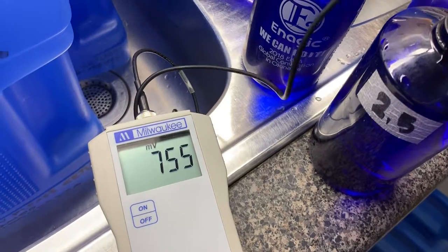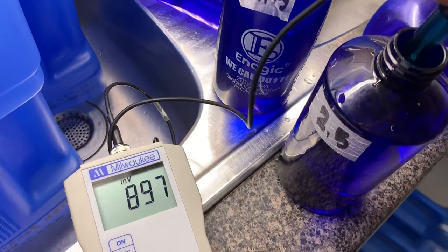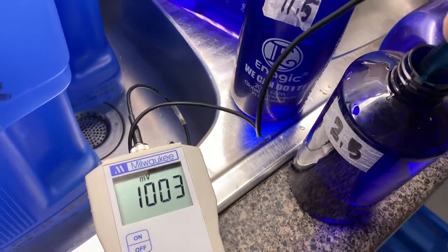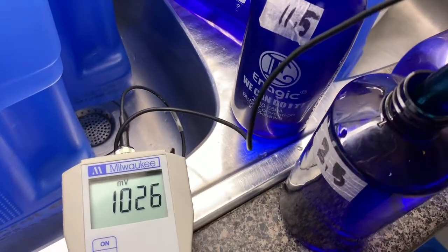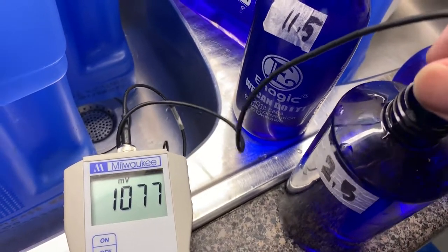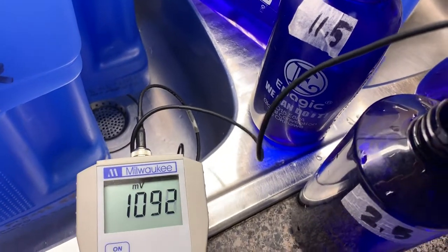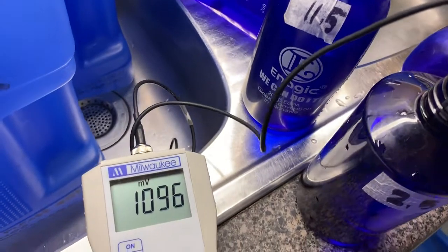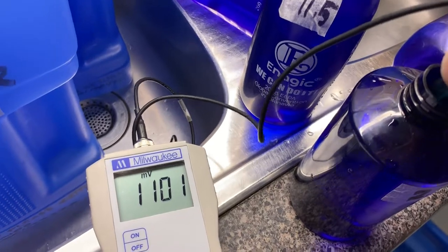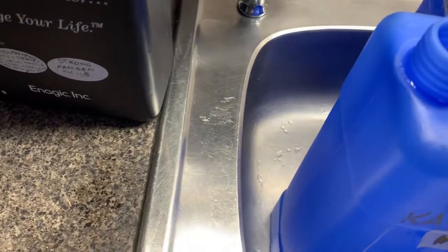See it jump to 700 now on the 2.5. Wait till it reaches 1000 — okay, 1000. It reaches 1100 — very close. Above 1100 — that's good enough. Then switch to 11.5 again.